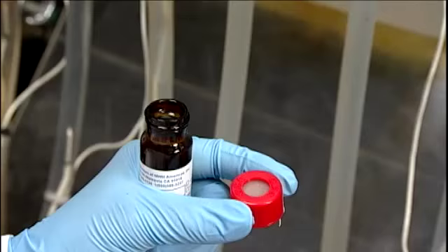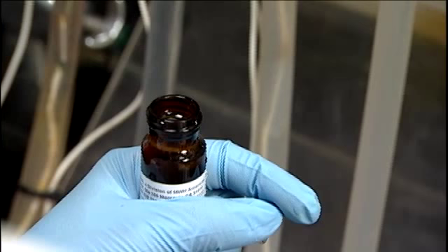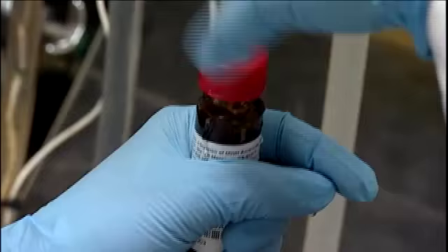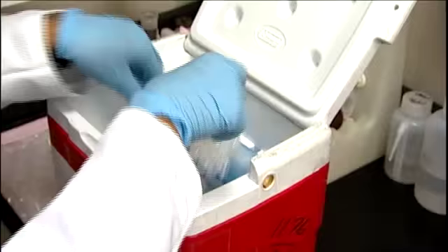Fill the bottle to the shoulder, or about one quarter inch from the top. Carefully add any additional required preservative if needed. If using an acid preservative, use caution and appropriate personal protection such as safety glasses or gloves, and immediately rinse off any acid that contacts skin or clothing. Top off the container by pouring water from the cap into the vial. When the bottle is full, there should be a convex or crescent shape to the water over the lip. Carefully replace the cap, tighten, and invert to check for bubbles. If a bubble is present, remove the cap and top off again, then cap and check to ensure there is no headspace.